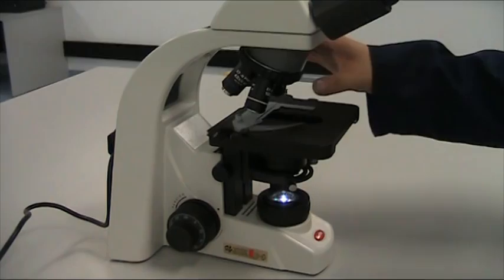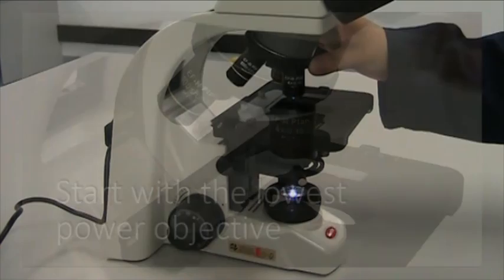Swing the lowest power objective, which is four times on this microscope, into place by rotating the nose piece. Don't rotate by pushing on the objectives.